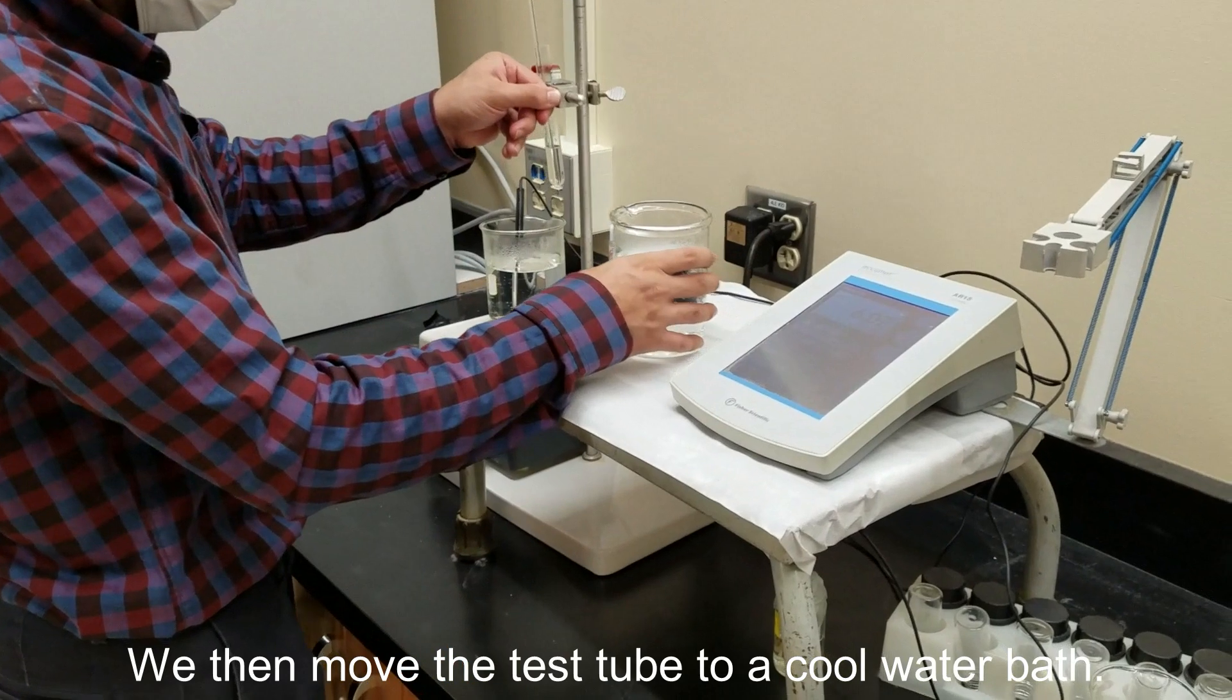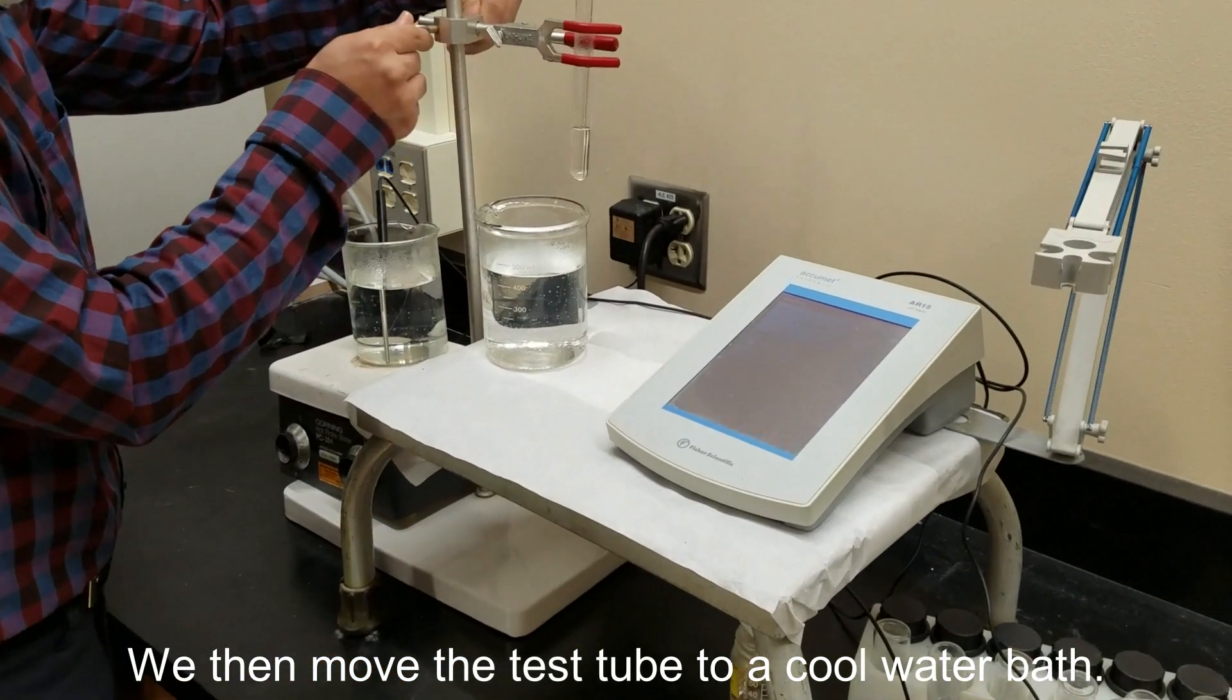Now we take our solution and put it into a cool water bath. This will start to cool the water back down.